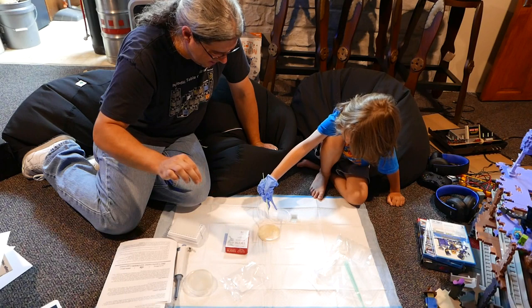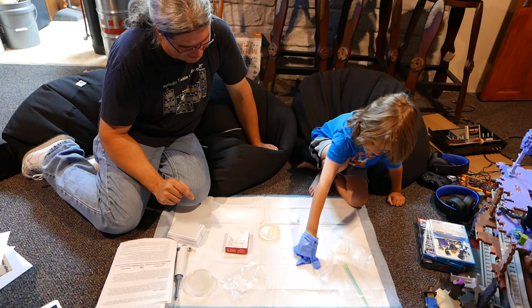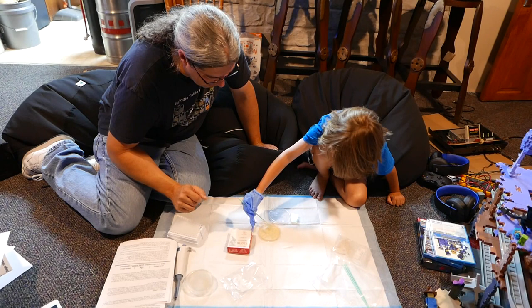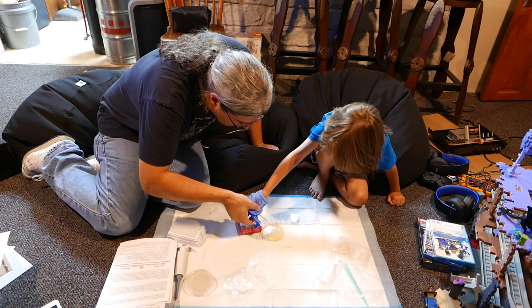No. Set it down. Pick it up by the handle. Yeah, you want to scrape. Yes. There you go. Perfect. Pick it up right there. Yep. Scrape it on it. You want to get it. I don't see it. It's clear. You can barely see it, daddy. There you go.